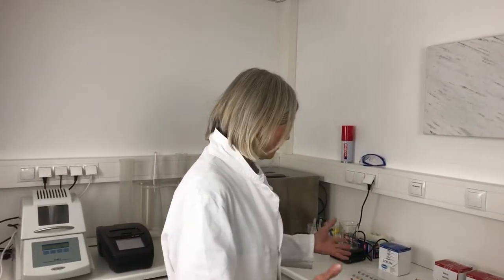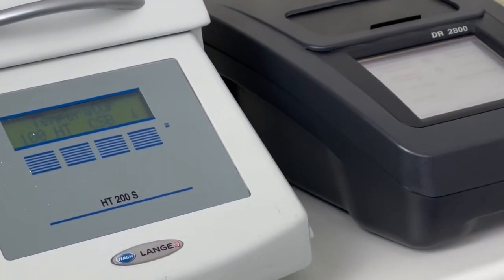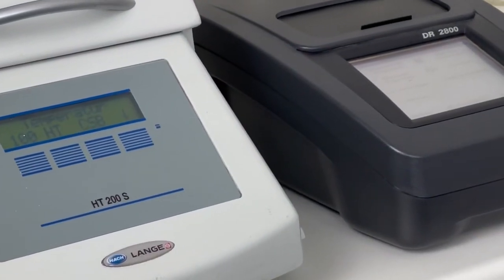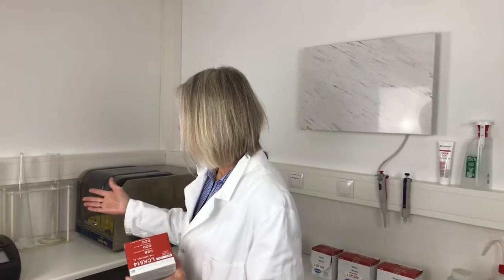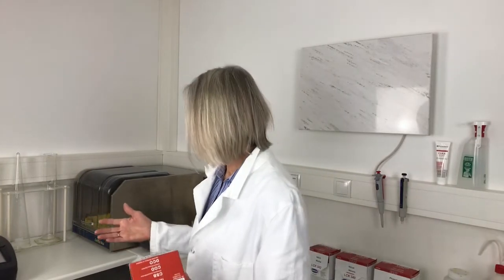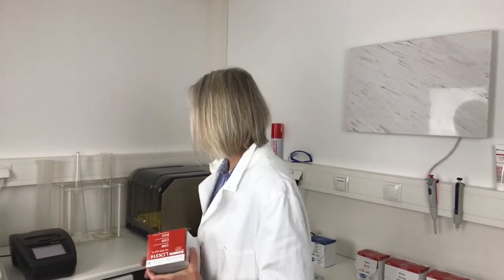Let me show you in detail the procedure to detect the COD. For that, we need a special heating device, and after cooking and heating, we analyze the concentration of the COD in PPM using our photometer.